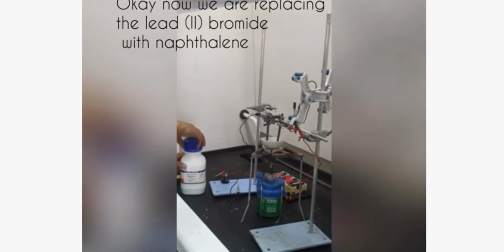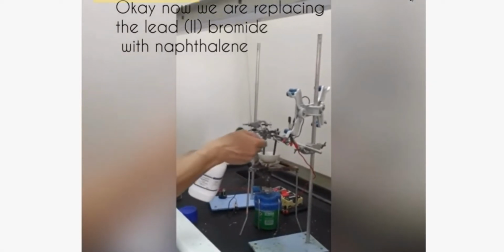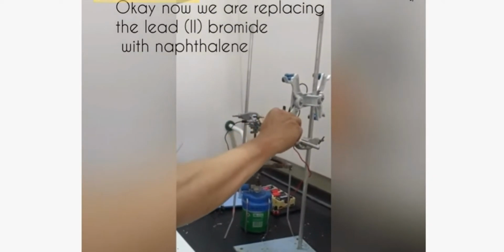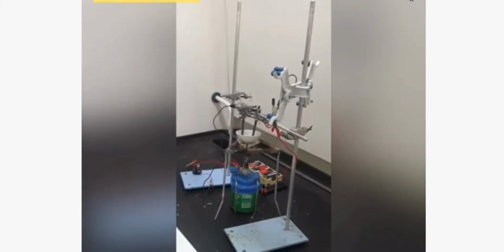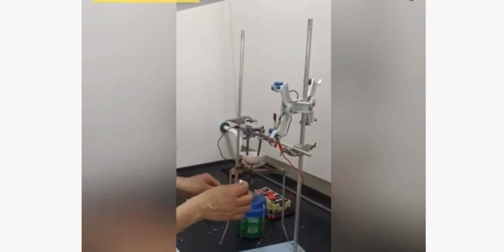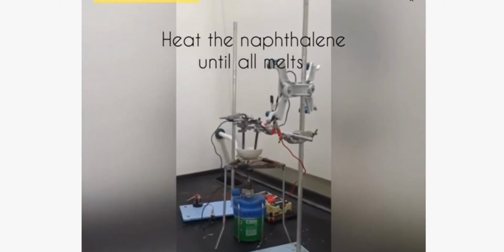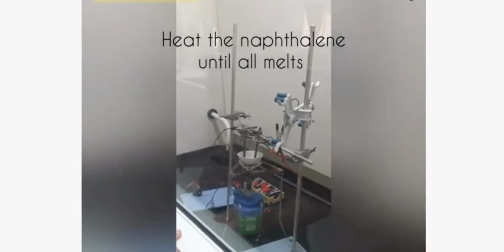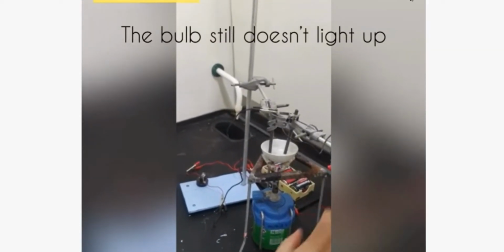Alright, now we are going to repeat the experiment. We are going to replace the lead bromide with naphthalene. Naphthalene is a covalent compound. 换 naphthalene，不能传电，烧融它。Then we heat the naphthalene until all the solid melts. Naphthalene 的味道也很大。OK，melt 了。So we turn on the switch again and see. 灯泡还是没有着。The bulb still does not light up.